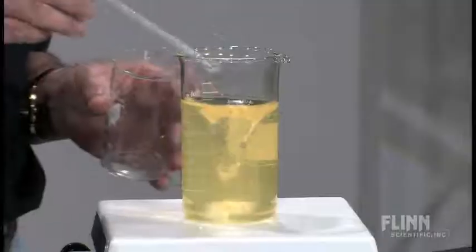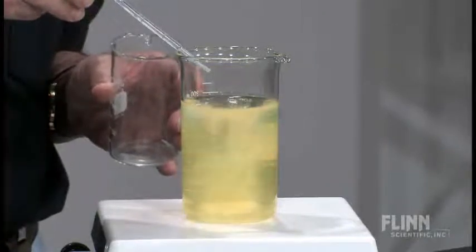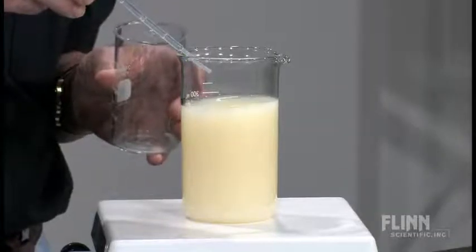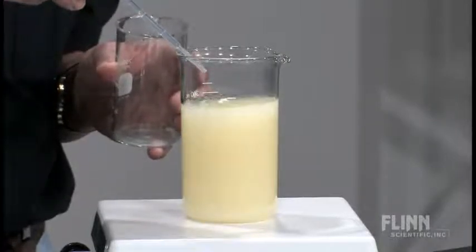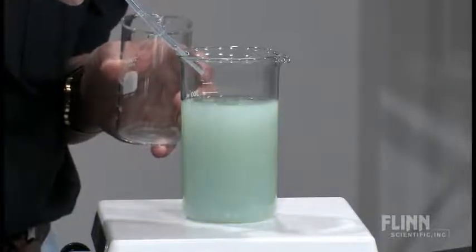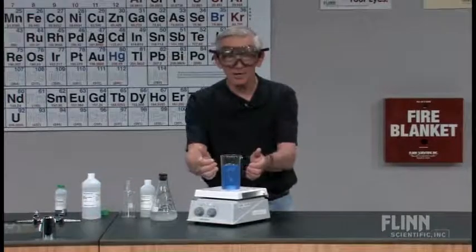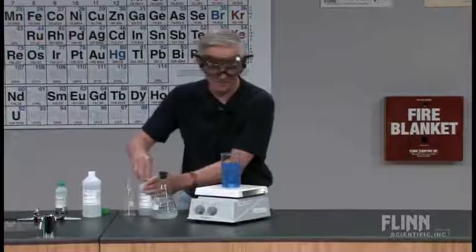Let's go back the other way. There's about my isoelectric point — clearly it's yellow. I'm seeing green. And now I'm getting on to blue. Just at the end there I had some serious thickness — I had left it there long enough that it was starting to get ready to precipitate.